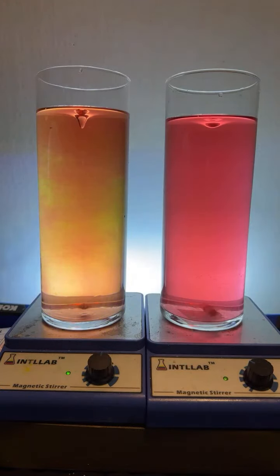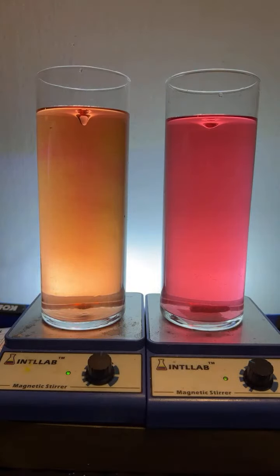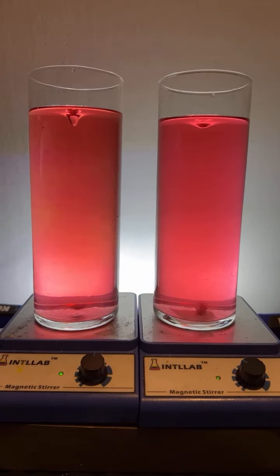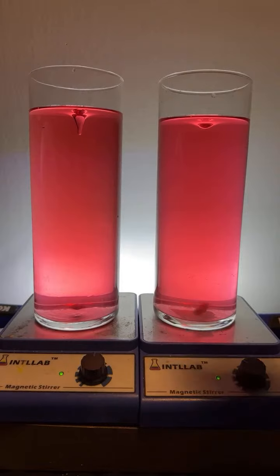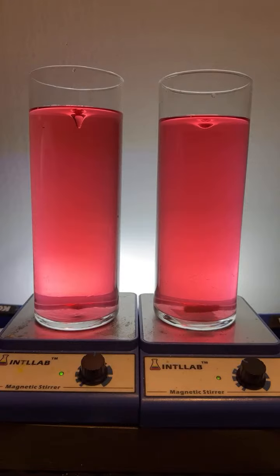Palacroy, what I am using is 20% by weight sodium hydroxide and 20% by weight hydrochloric acid. That's all I'm using. And then it's just water with universal indicator added. It's easy. Again, I'm using 20% by weight hydrochloric acid and 20% by weight sodium hydroxide. Thank you there, Draking. I appreciate that.